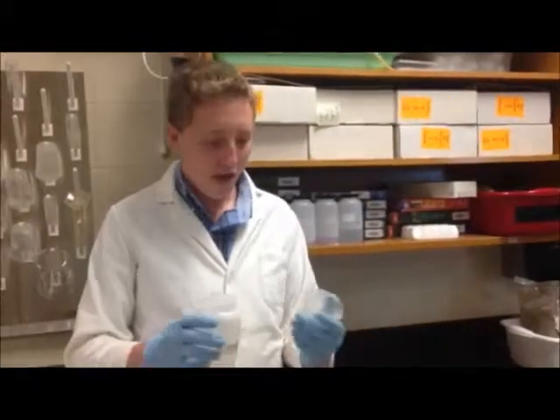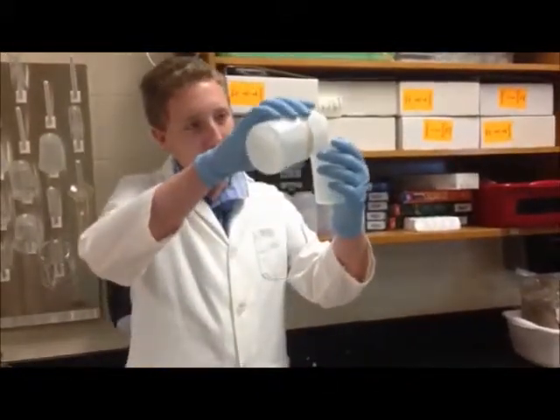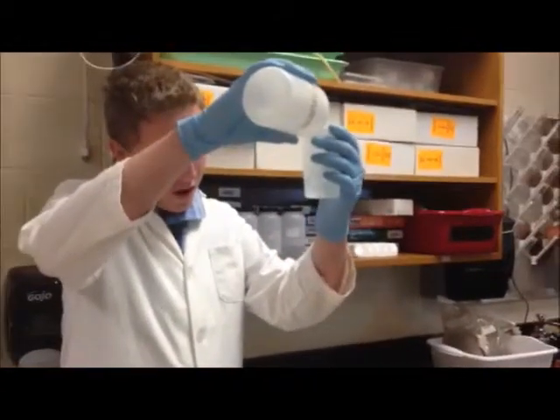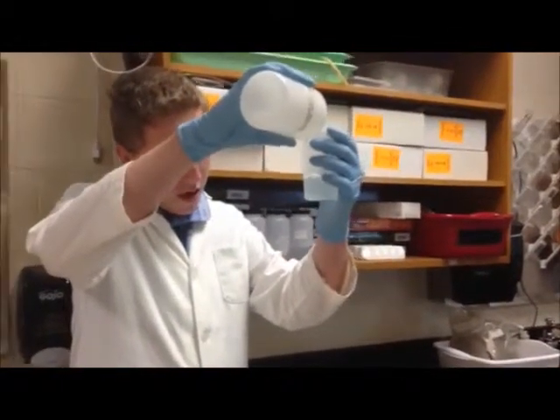We begin by soaking 20 peas in 80 milliliters of each molarity solution. We leave the 20 peas in the solutions for 24 hours before starting the experiment.